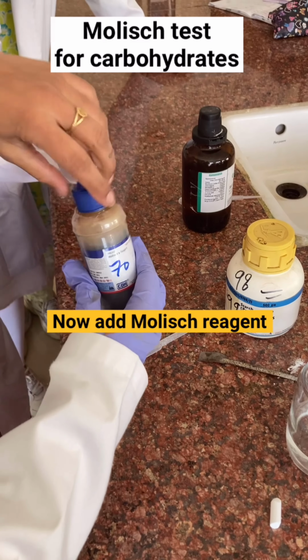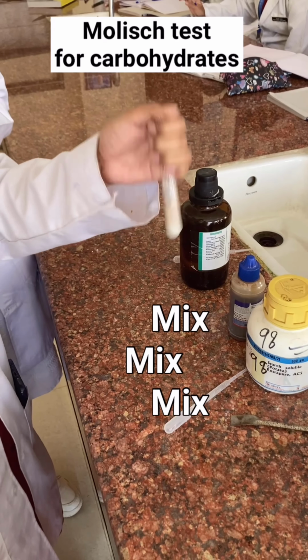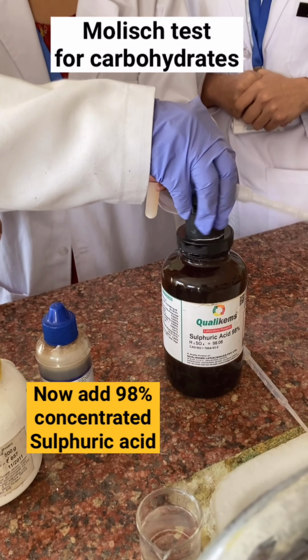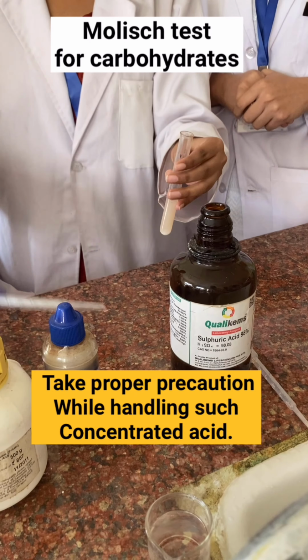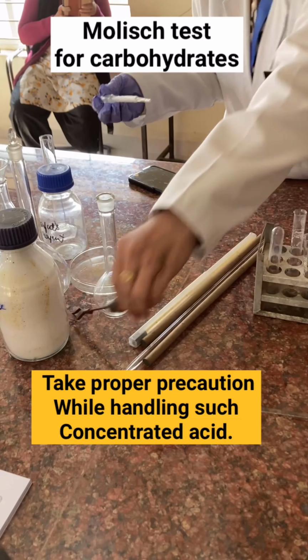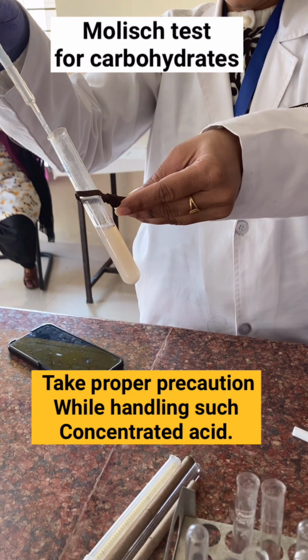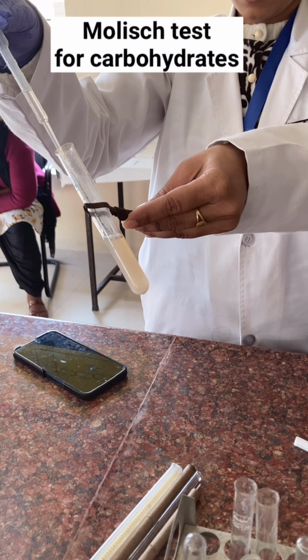After mixing it, you have to add the Molisch reagent, and alpha naphthol is the active reagent present in this Molisch reagent. So after doing all this, we are going to add the concentrated sulfuric acid. Since it is 98% concentrate, we have to take proper precautions while handling. So we are using a dropper and keeping the acid far away from us, and we should not be smelling it directly. And then we are holding the test tube with the test tube holder, and then putting a few drops of sulfuric acid into the test tube.